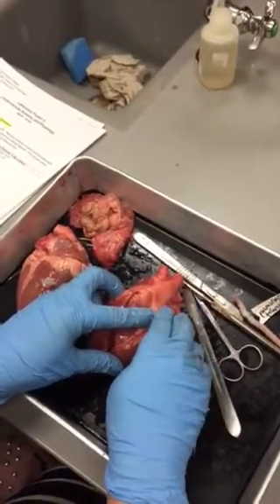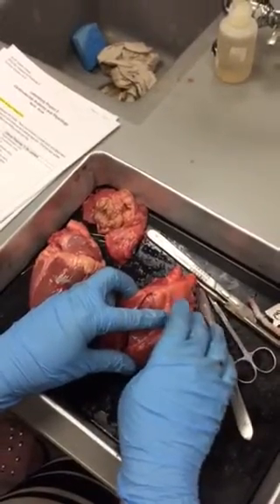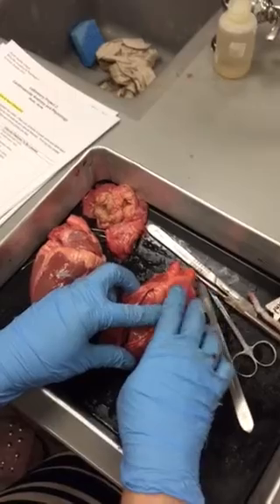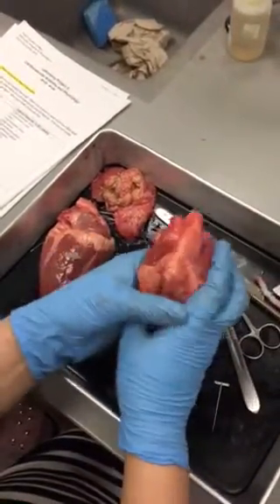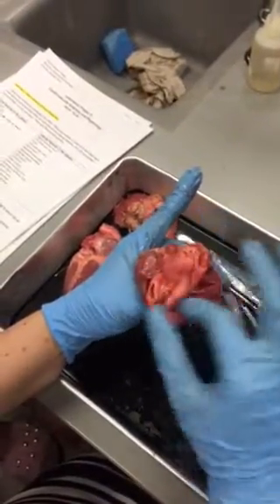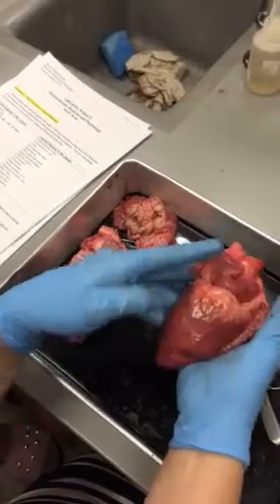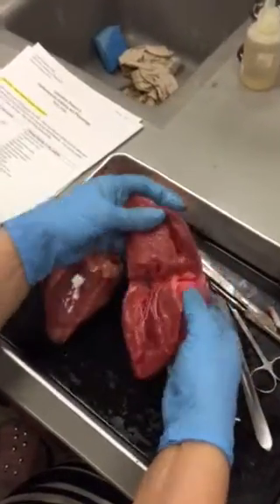You guys are doing this on the model as well. If you identify a structure that is paired on the left and the right, if only one is tagged, you have to specify if it's left or right, okay? Okay, so then you have a bunch of vessels on top, and we left these intact so that we'll be able to follow them into the chambers. So first we're going to look at the chambers, and then we'll follow those vessels, okay?